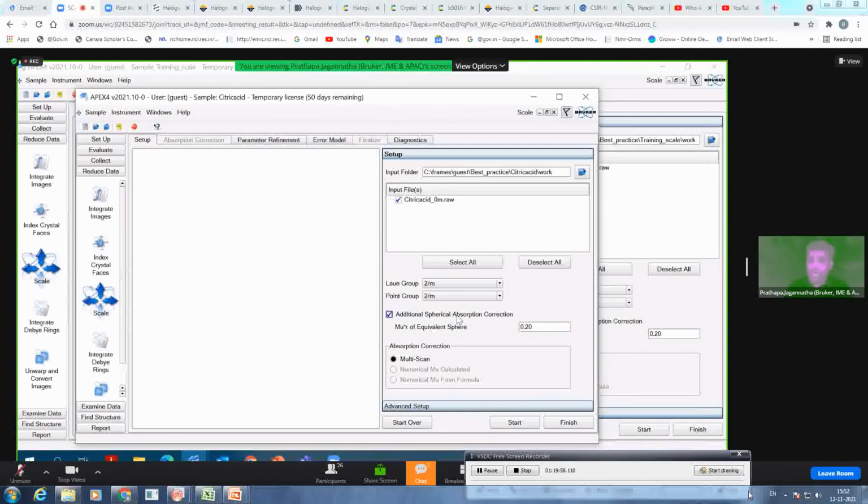And then this is an additional spherical absorption correction you are doing with SADABS. The default value, tried and tested with a lot of crystals, we have come up with is 0.2. But if your crystal is too absorbing and you have mounted a very anisotropic crystal, consider changing this value. You will get the absorption coefficient value in your CIF file. And then you get the average crystal radius of your crystal, multiply this value, and whatever value you get, please put that value here and then redo the scaling.